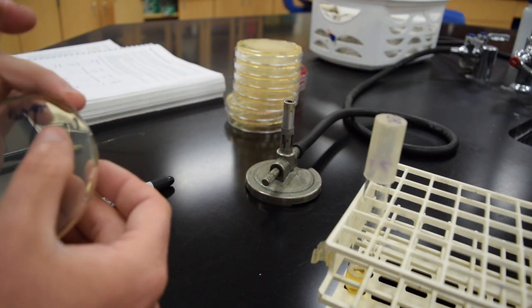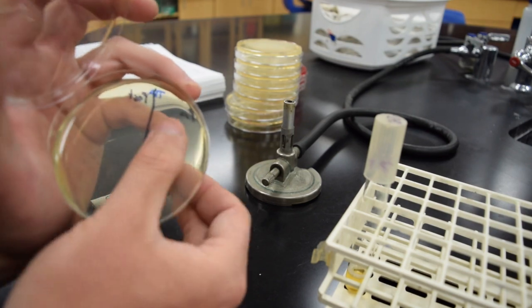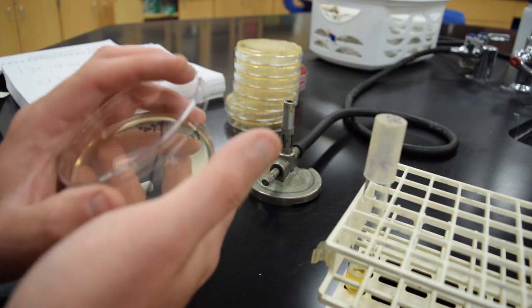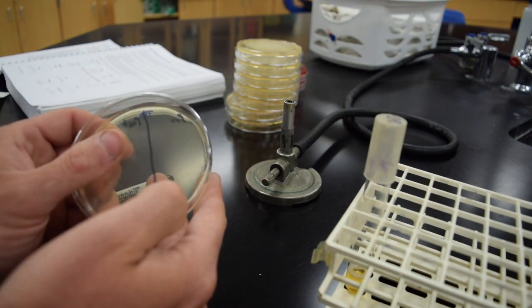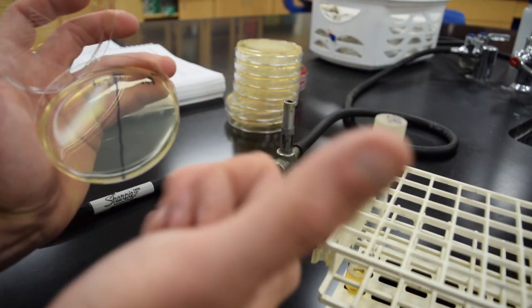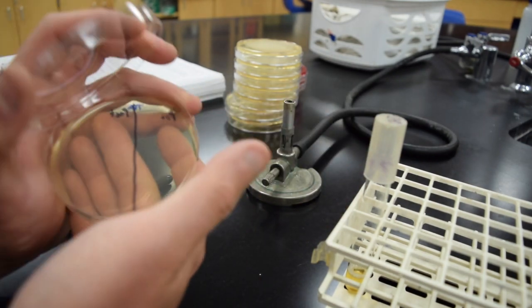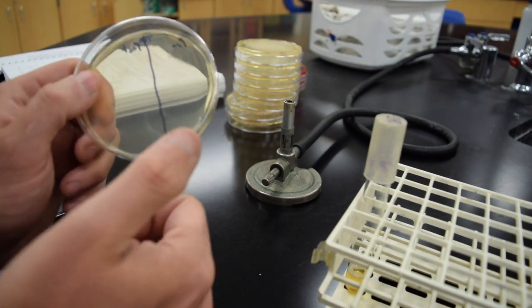Simply open this up and put your finger or thumb and just very carefully roll your finger around on that media. Don't press too hard or you'll smash the media. After that, you'll wash your hands and repeat that for the post-wash side of the plate — use that same finger after you go to the hand-washing station and wash your hands.